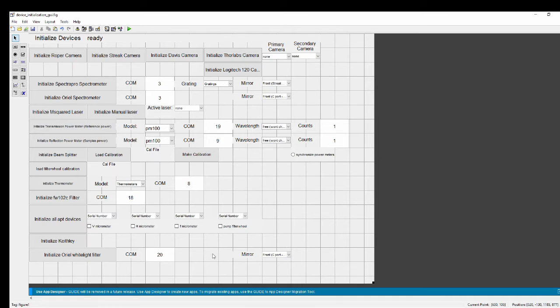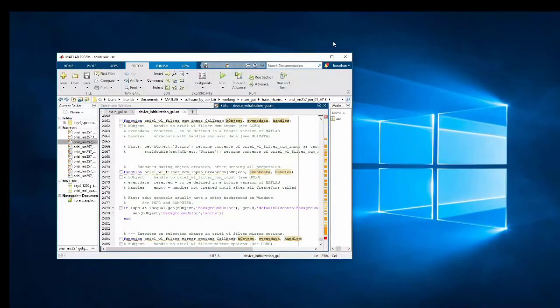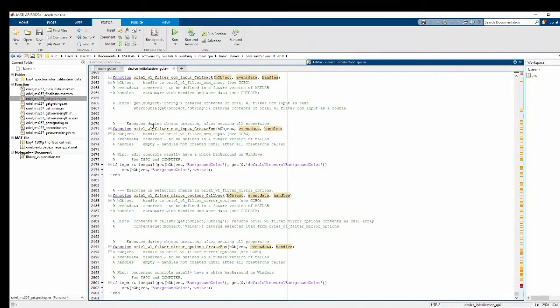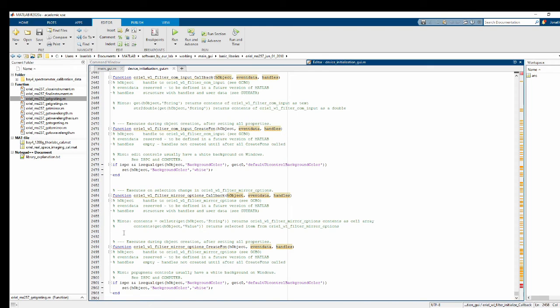Now we're ready to start editing the callback functions of these buttons. So what I'm going to do is just click anywhere on this GUI. I'm going to hit Control S to save it. And then I'm going to go ahead and close Guide, since I don't need it anymore for this. And now what that did for me is it automatically made these functions at the bottom.